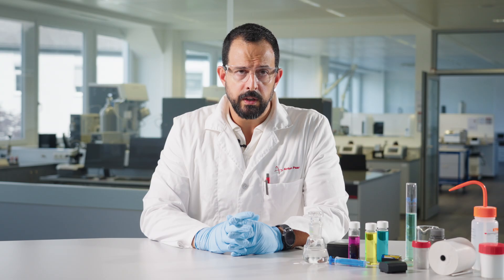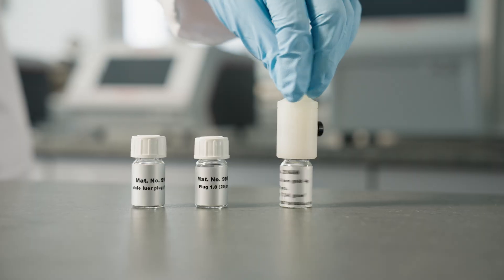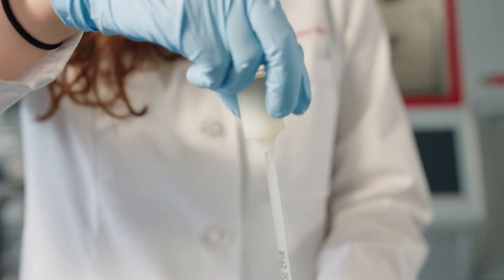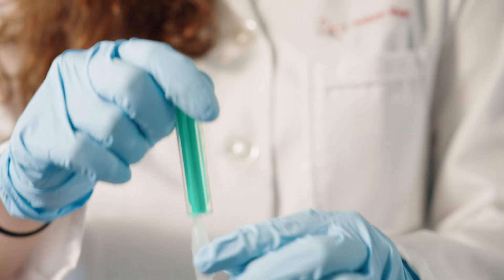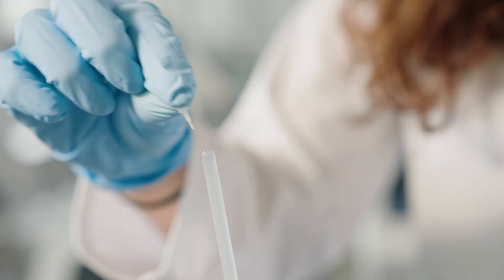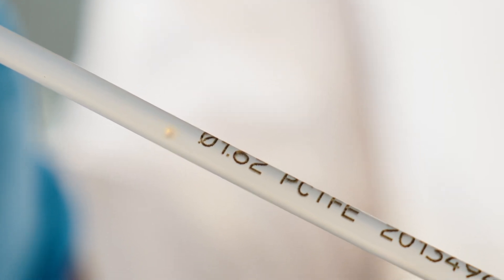While automatic filling is possible, it is not recommended when working at sub-zero temperatures to avoid temperature gradients. Instead, manual filling is recommended. Under a fume hood, attach the manual filling adapter to the capillary. Put in a gold-coated steel ball, which will be the rolling ball used for viscosity measurement. Attach the filling and cleaning adapter on the side of the capillary. Fill in the electrolyte solutions with a syringe, making sure to use a syringe material that is chemically resistant to the electrolyte solution. Remove the filling and cleaning adapter and plug the capillary on both sides. Check whether the gold-coated ball is rolling freely and that there are no air bubbles inside the capillary.